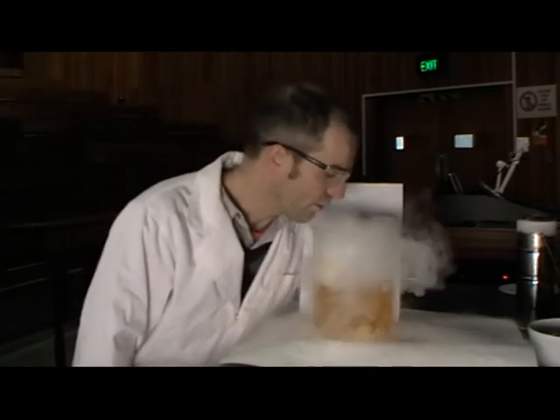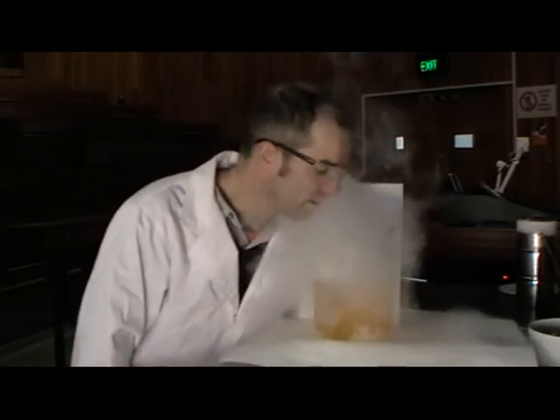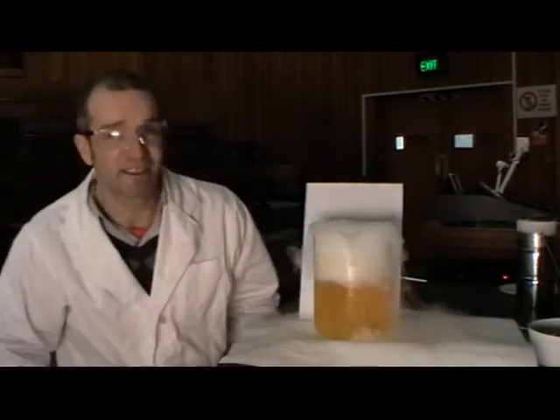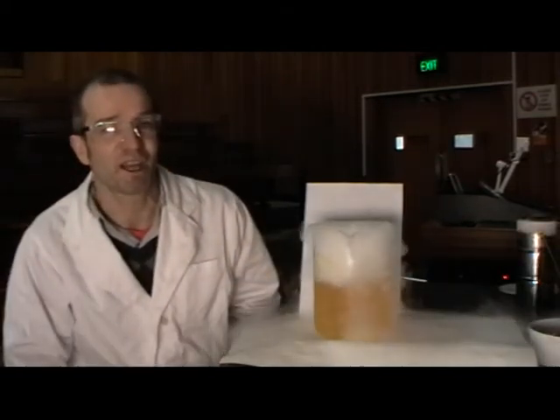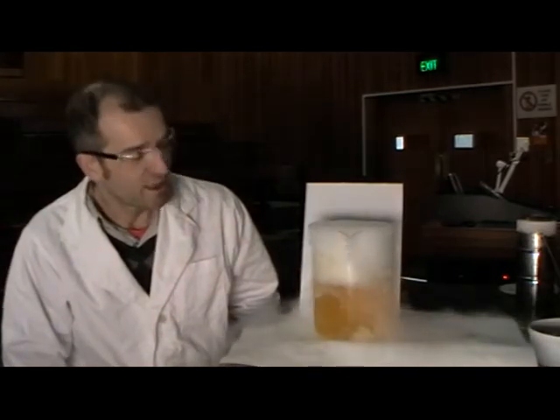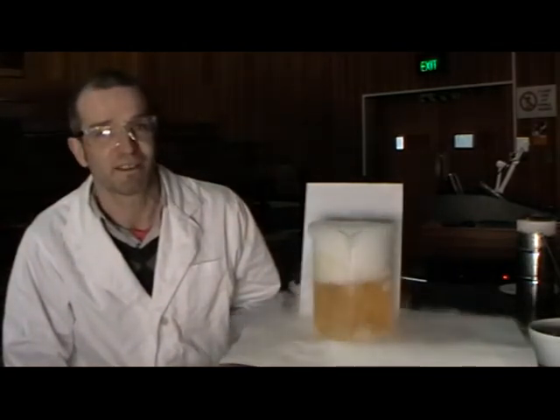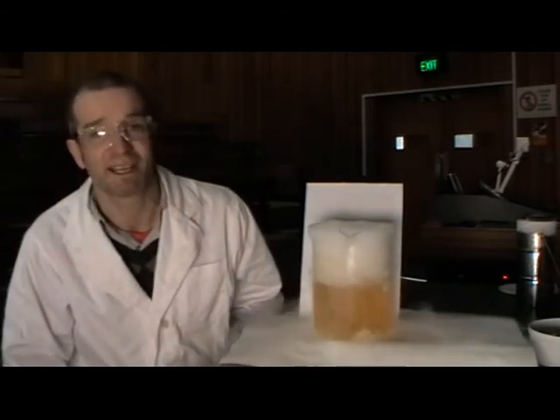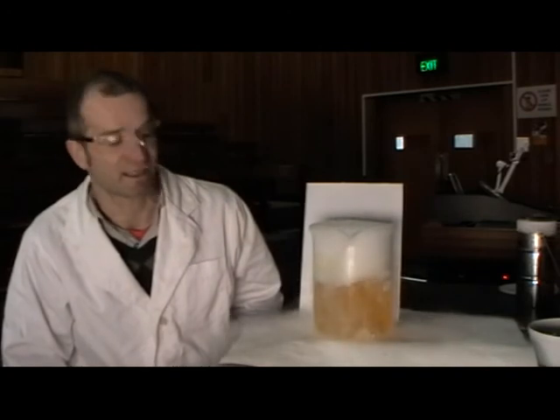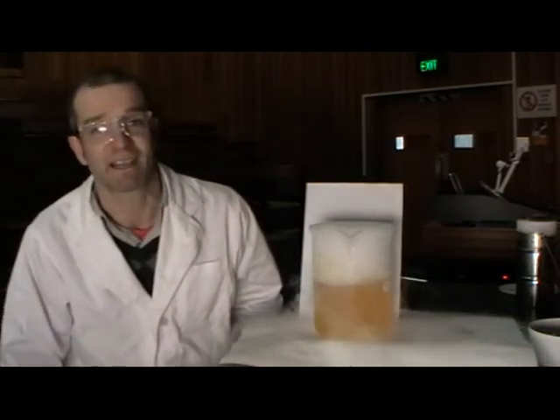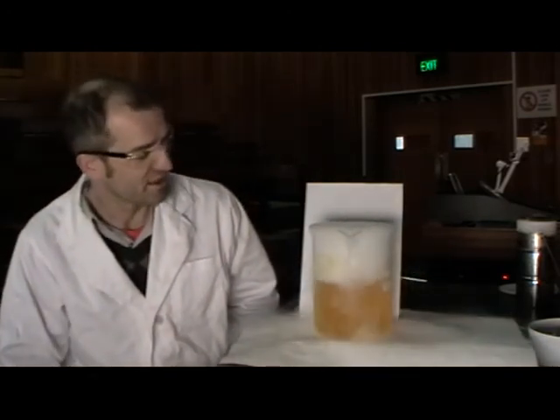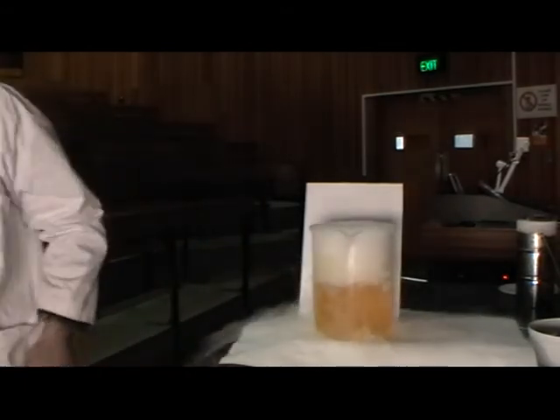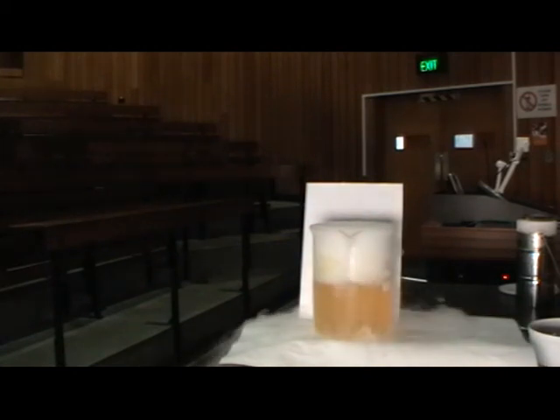I'm going to put my head in it. As long as I don't breathe too much, I'll be fine. It's going to stay at an orange color. It's probably not going to go any darker red than that because, as I said, it's only a weak acid. Carbon dioxide at minus 80 is a solid, but it is actually an acid. Even the gas in our mouths is an acid gas. It's only a weak acid, but it is an acid. We'll just leave that to bubble away.